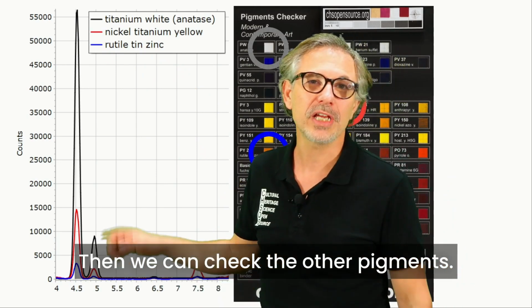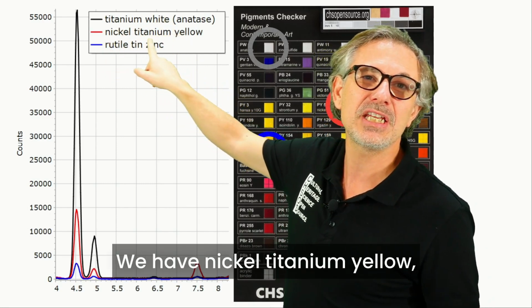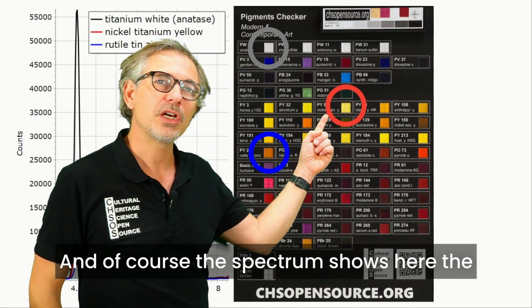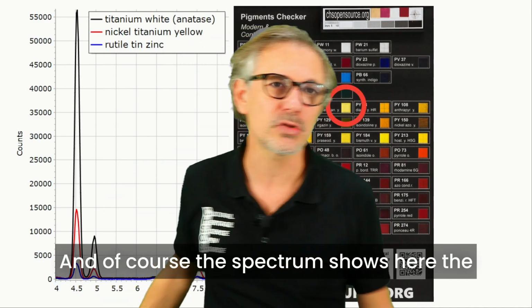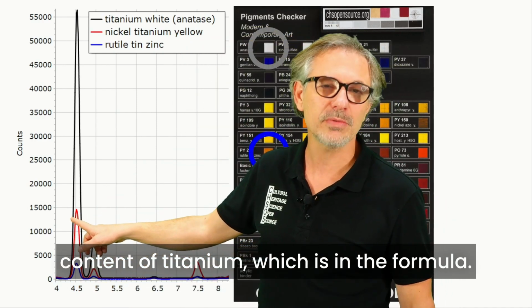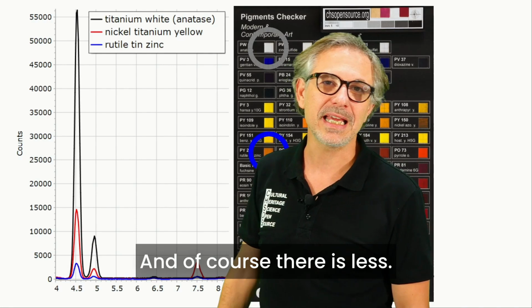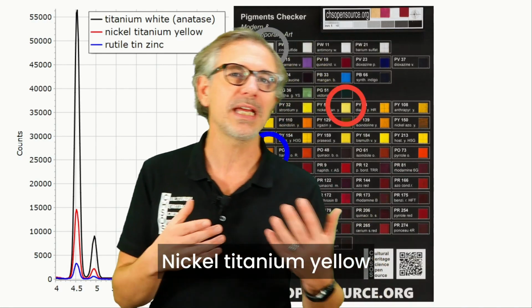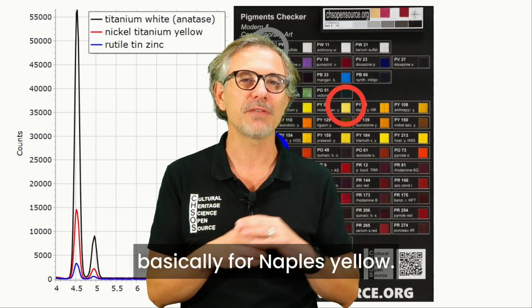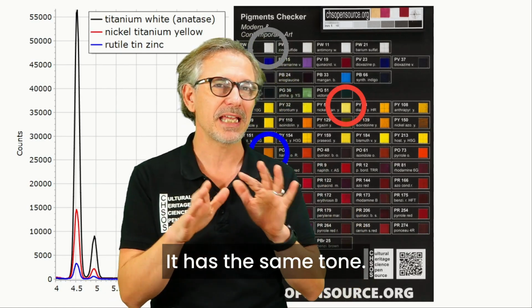Then we can check the other pigments. We have nickel titanium yellow over here, and of course the spectrum shows the content of titanium, which is in the formula, and of course there is less. Nickel titanium yellow is used basically as a replacement for Naples yellow. It has the same tone.